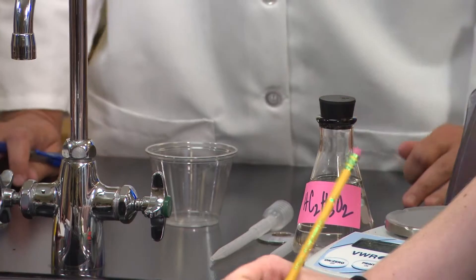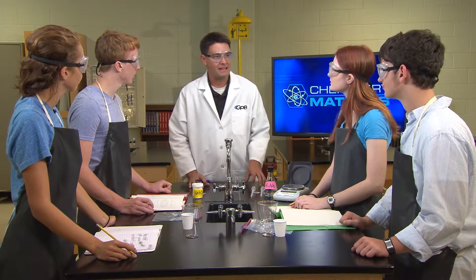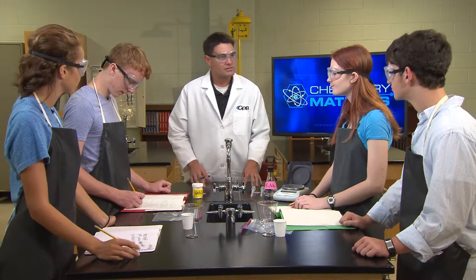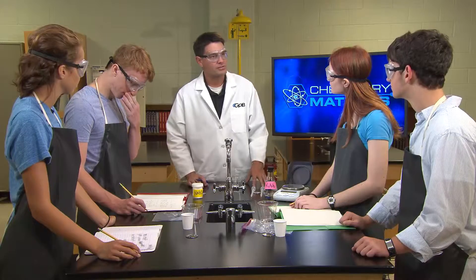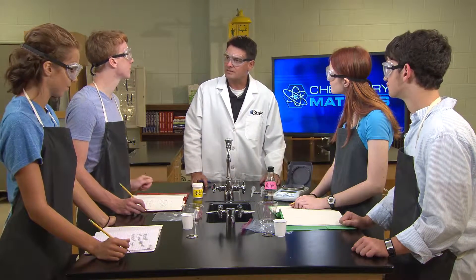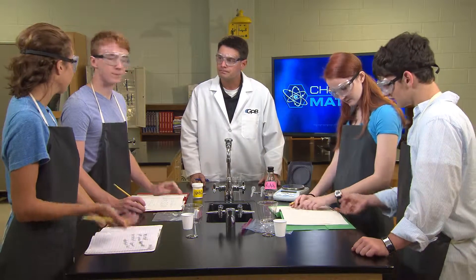These are going to act as your reactants. Remember, you want to measure out the mass of the powder and the mass of the acid, but don't include the mass of the cup or the baggie. Talk with each other about the steps you'll need to take to ensure the masses of the reactants are correct, and once you've measured them we'll go on to the next step.